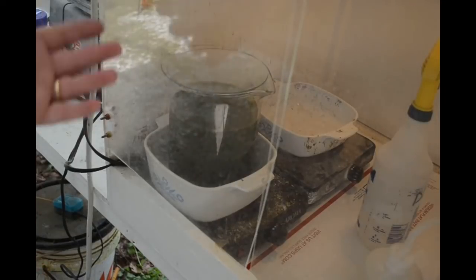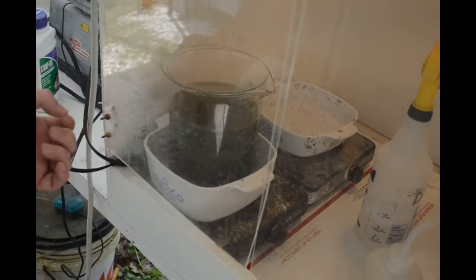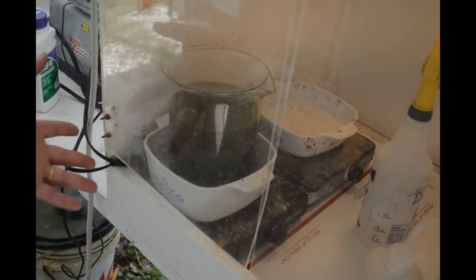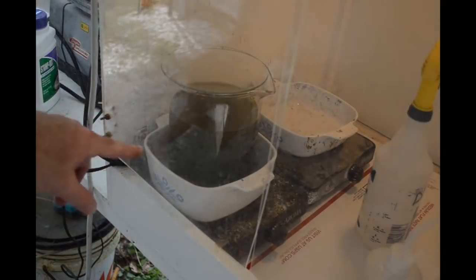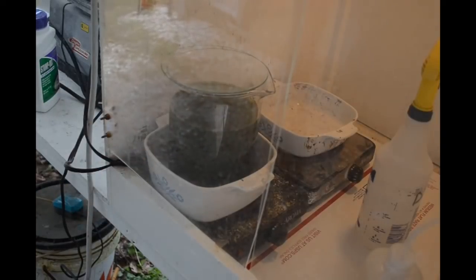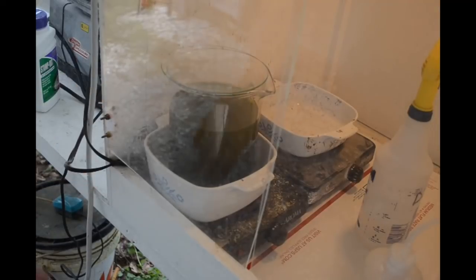Just as I suspected, because the liquid is so opaque the color change wasn't all that visible — it just went kind of a chalky dark yellow-green color, and then it sort of cleared up again as stuff started settling to the bottom. So we are getting a film of gold on the bottom. Gold is settling out. I'm just going to let it settle, maybe overnight, and we'll see what we got.